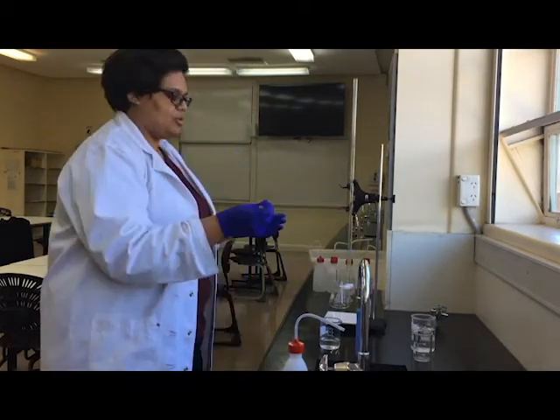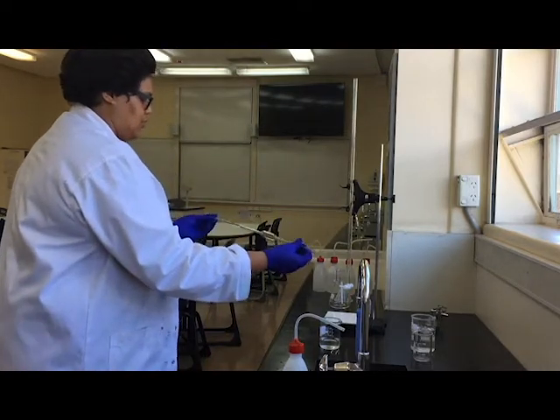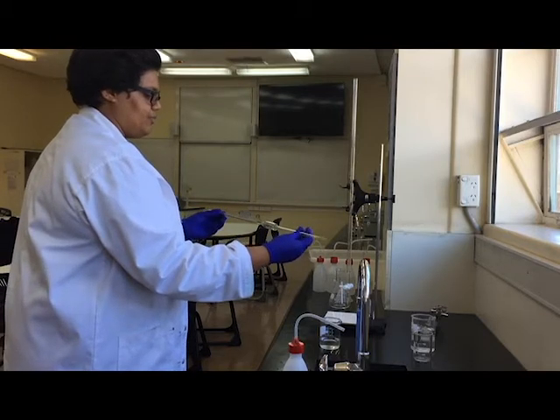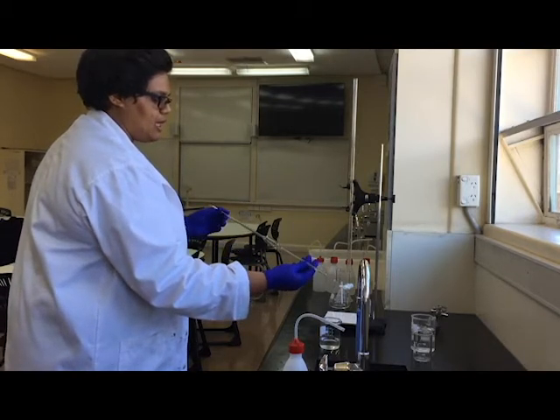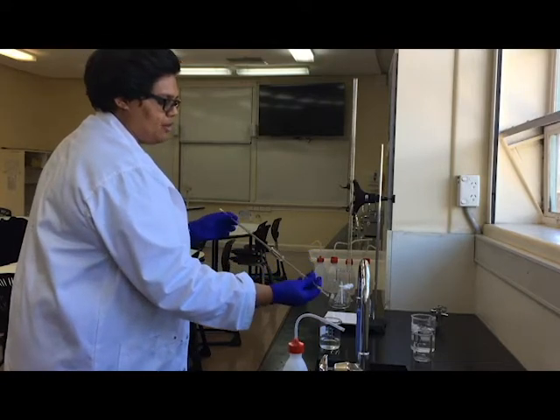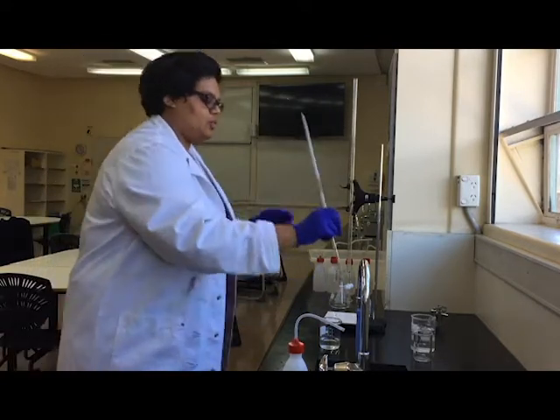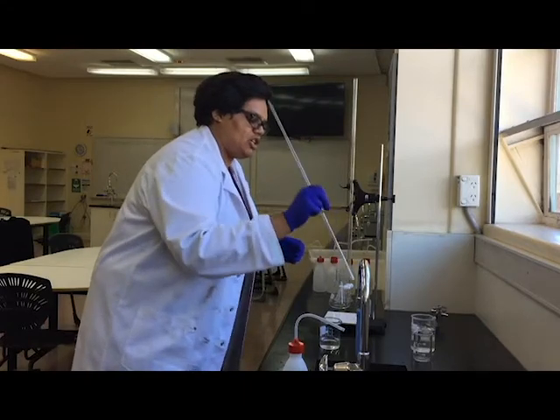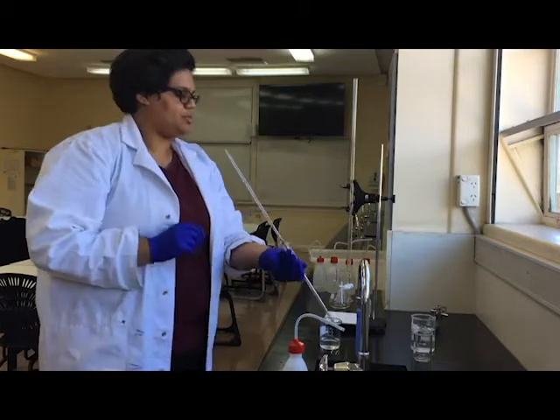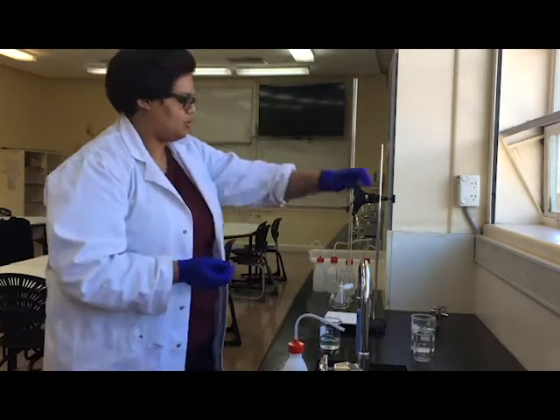I'm going to do the same thing before where I'm going to twist it and move it across and coat the inside of the glassware with the hydrochloric acid. I'm going to go all the way to the end of the pipette just to make sure I've got all the water out, because the problem is if there's any distilled water left in there, it's going to change the concentration of our sample that we're moving. Now remember, we always put the pipette lying down on the bench without the bulb.